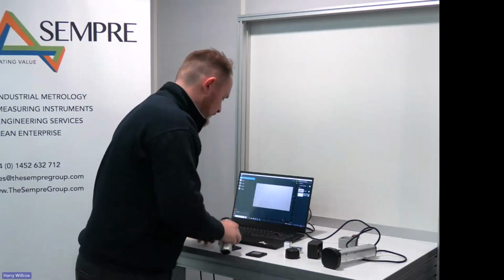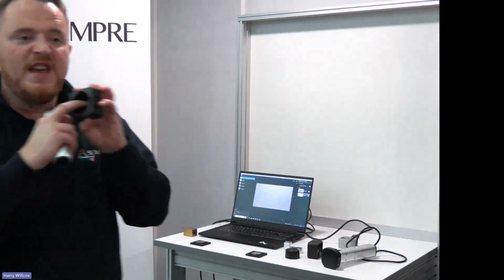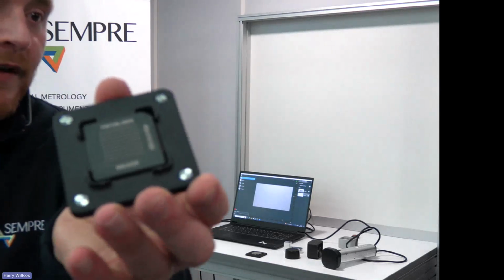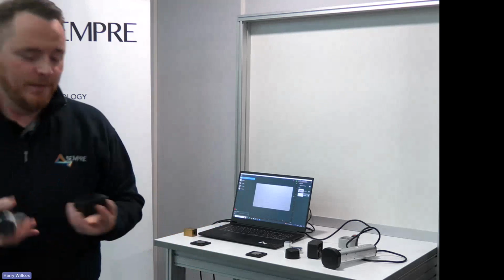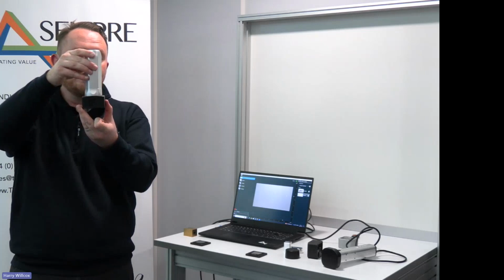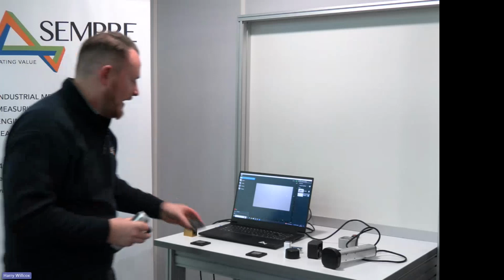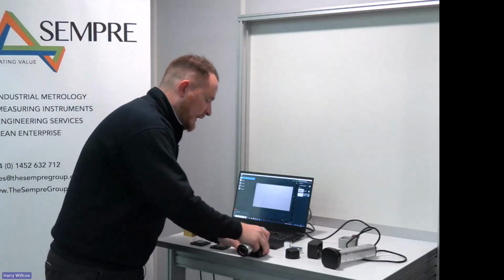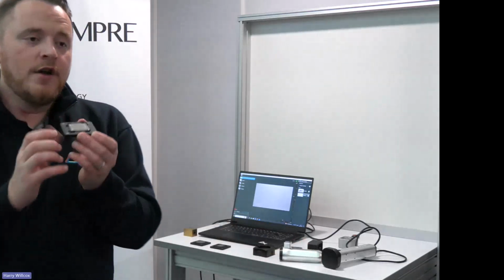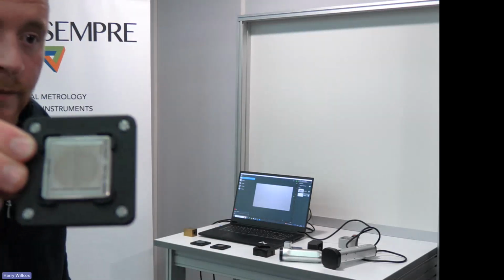Once we've completed that scan, we go to what's called our BGA. Our BGA is an assortment of spheres, effectively, in a specific position. To give you an indication, it's quite small, but hopefully you can see the setup of the balls. The idea being, we take a scan at 0 degrees, we rotate, and take another one at 90, 180, 270. So that's 5 scans so far to get the calibration. And the last one is what we call a G500 plate. We've got a known groove depth, and you can see there's a flat bottom slot.